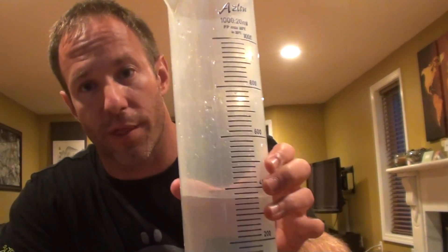I'm back with the graduated cylinder — as you can tell, it's about a third of the way filled with water. When you measure the volume of the liquid, you want to make sure that you get down to eye level and read the bottom of the meniscus. When I look at this now, the meniscus is in between 380 and 400 milliliters, pretty much right in the middle, so I'm going to estimate about 390 milliliters. I'll write that down as my initial volume of water.